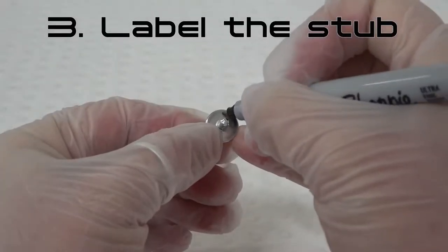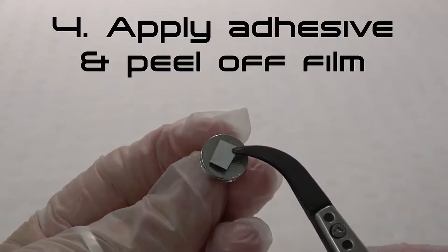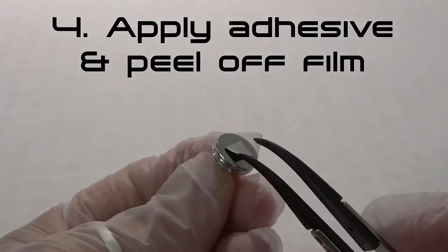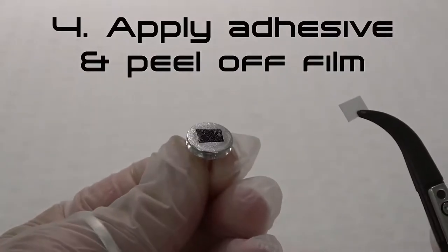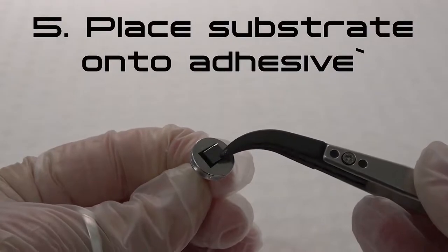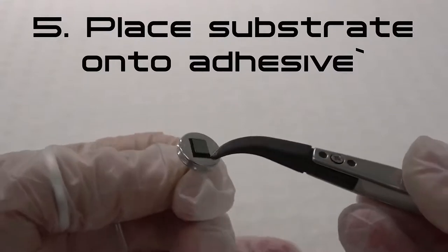Step 3: Label your SEM stub with the sample name or ID code. Step 4: Place one side of the double-sided adhesive onto the SEM stub, then remove the protective film to expose the surface of the double-sided adhesive. Step 5: Place the substrate on the adhesive and apply gentle pressure to fix the substrate securely, taking care not to damage the surface.